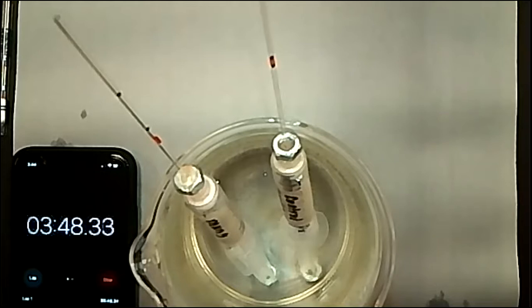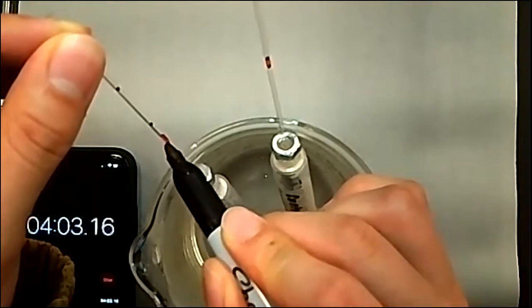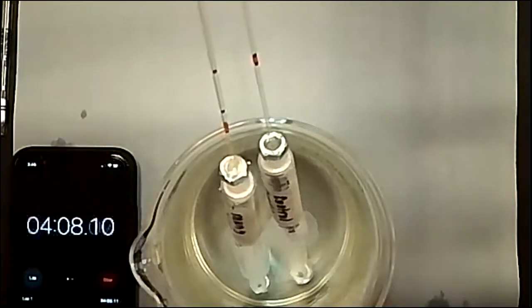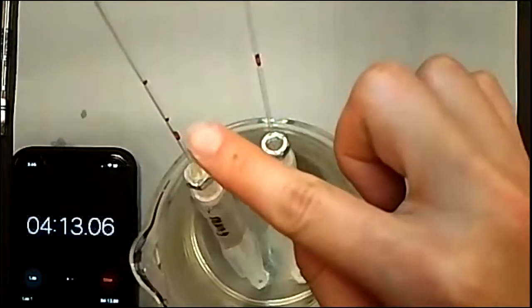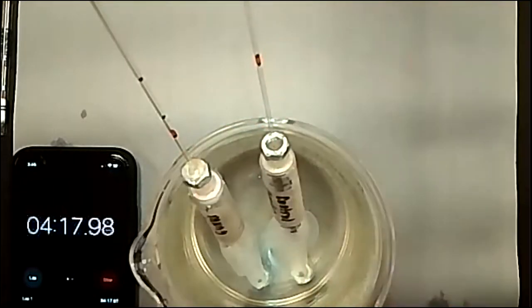So again, we're coming up on the 4-minute mark, and we probably will go to a little bit over 8 minutes to collect data. And I will mark the location of the bottom of the plug, and it looks like our control one is no longer moving. So that's a good sign. So our mung bean one is still using up oxygen. It's going from 1, 2 to 3, and then here we go 1, 2, 2. So it stayed pretty much in the same area, which means we won't really have to do any calculations on the amount of change that occurred.